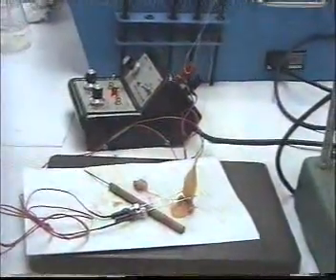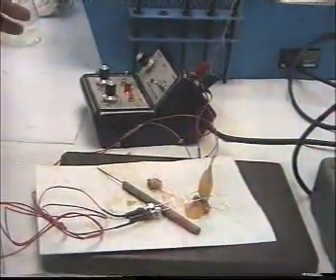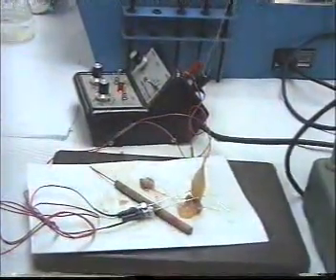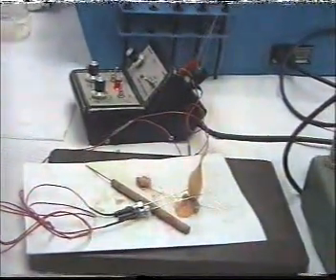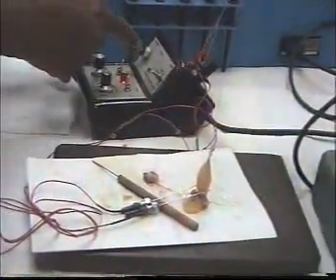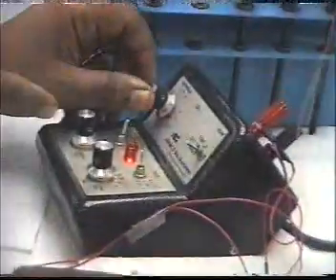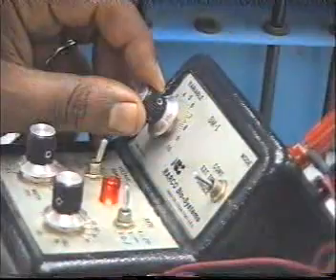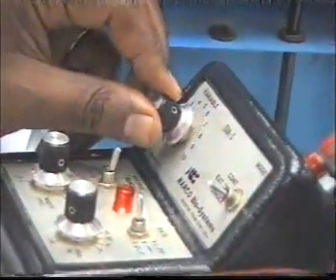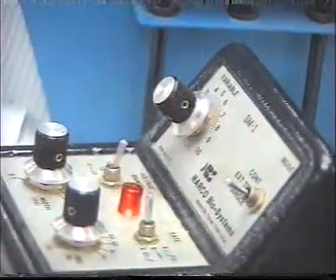After that, we can do all our applications. You can see the effect. We can record normal simple muscle contraction, and also we can record the effect of increasing the strength of the stimulus, and then we see the effect of different voltage levels.